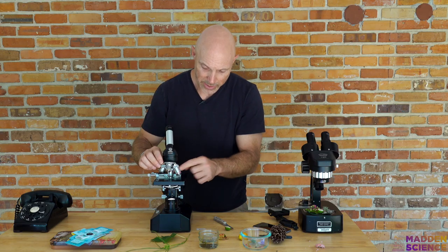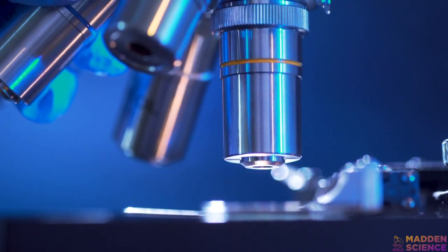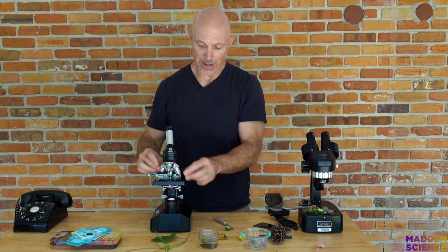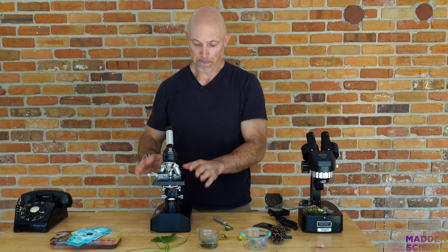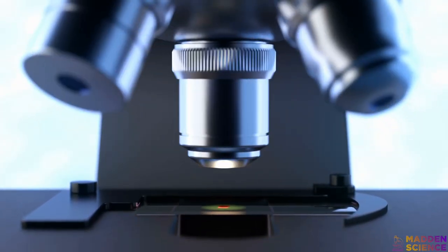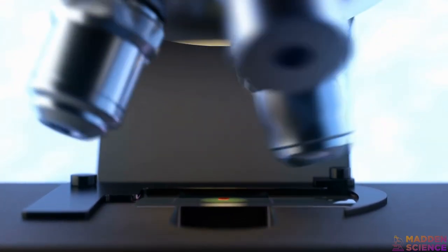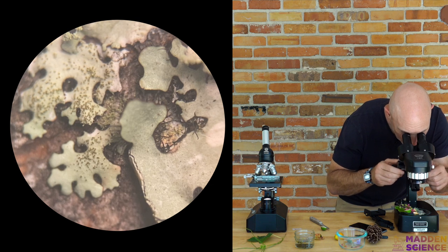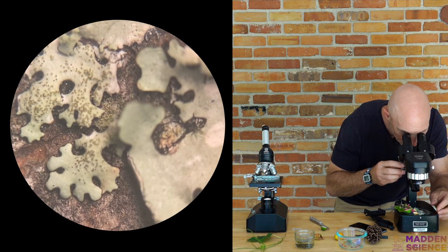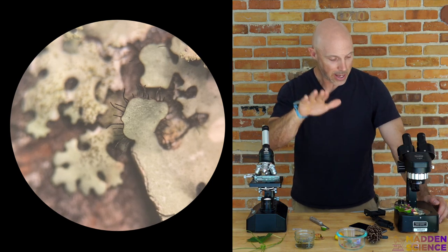Once it's under 100 magnification, you can go higher, and some microscopes allow you to do oil immersion. Either way, the main goals are: get your specimen secured, start at farthest away and lowest power, then work your way up. Start far away and scoot in. If I'm looking at lichen that is on tree bark, it's very 3D, so you can move through layers as you go.